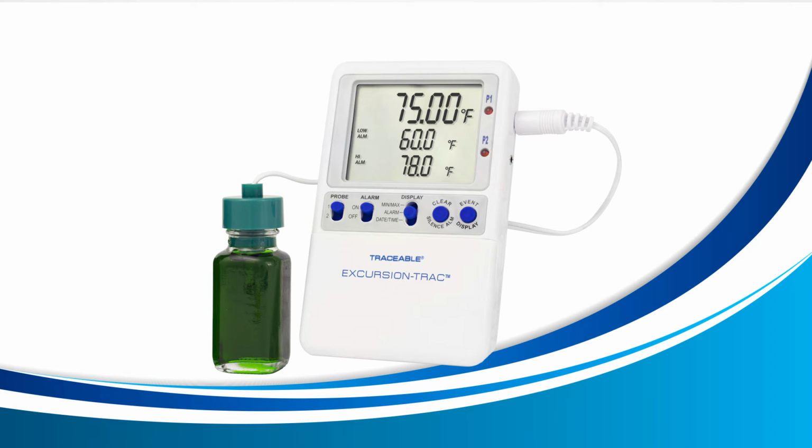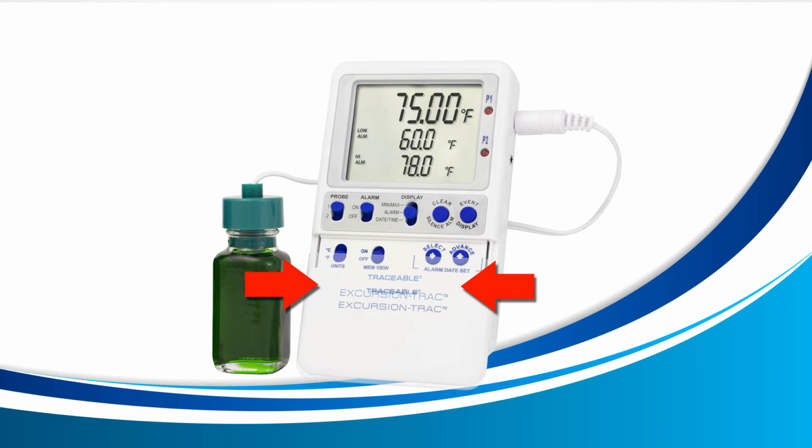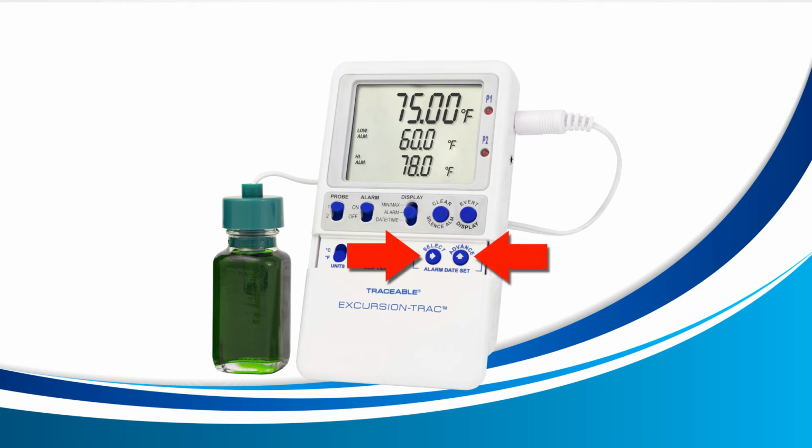And third, we'll need to lower the bottom door to our device to reveal the select and advanced buttons. Press your thumbs on both sides here and slide the door down. Once you do this, you'll find the select and advanced buttons on the right. These are the two buttons we'll be using to set our alarm limits. Let's learn about each button now.